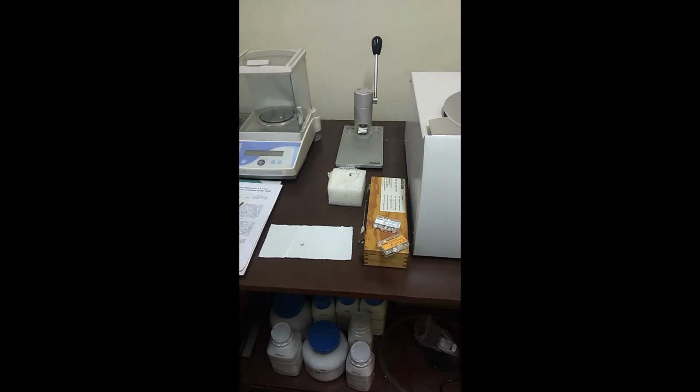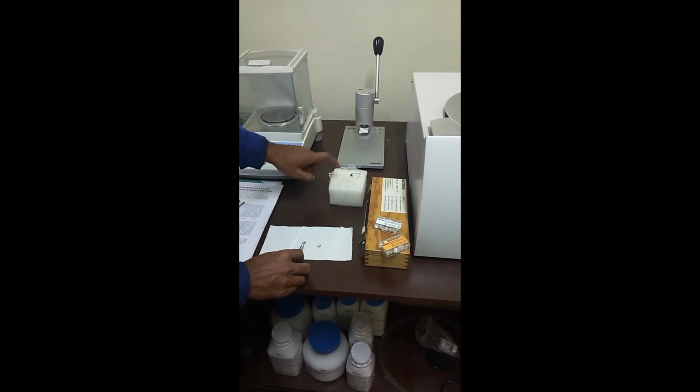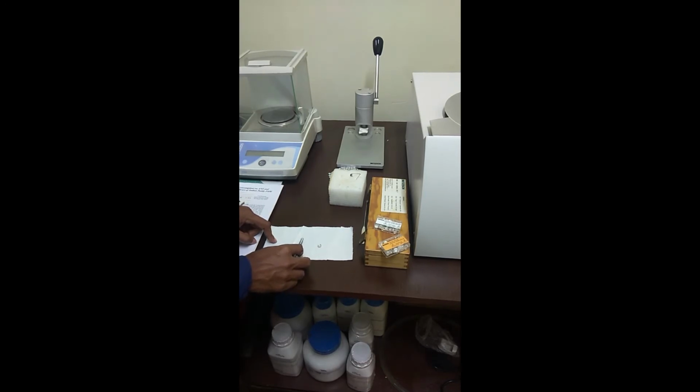So the already known weight of the crucible is 23 mg, and we will subtract the weight of the crucible, and so now we know that the sample weight which we have is 48 mg. We will now bring the crucible back and we'll cover it with the lid. The handling of the crucible and the lid is very sensitive, and it should be done using a sharp forceps.